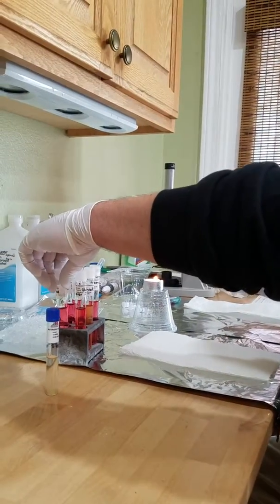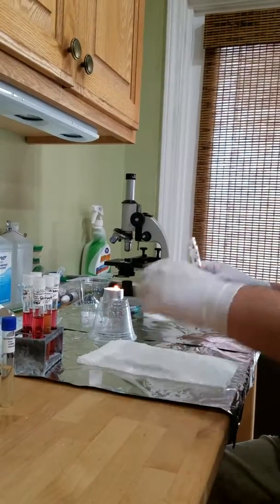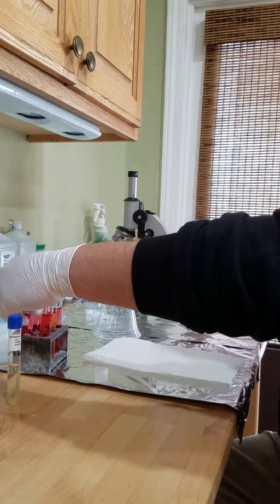Now we're going to flame these, and then we're going to do the epidermidis. So we're going to flame open.